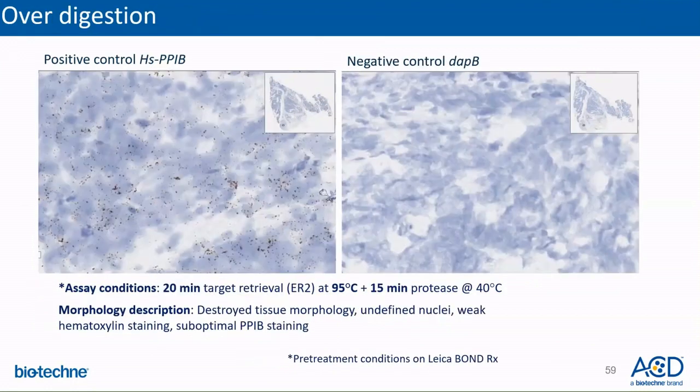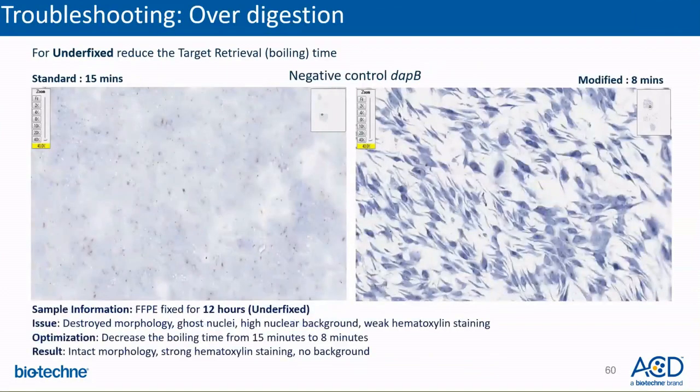Compared to the previous slide, this image shows a tissue that has been overdigested, in which the nuclei are now undefined due to suboptimal tissue morphology, and the PPIB staining is slightly weaker than expected. Here, the target retrieval time was reduced to 8 minutes, and that improved the morphology and eliminated the background seen in negative control.